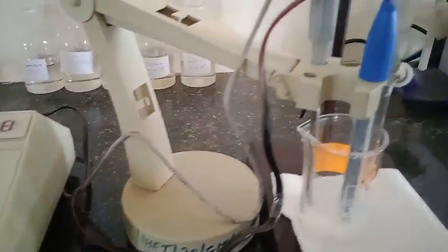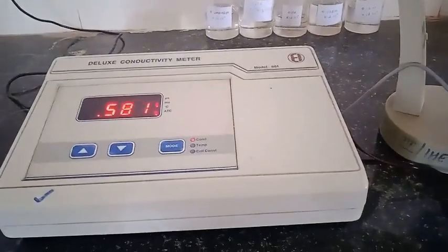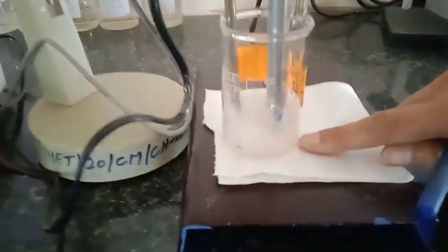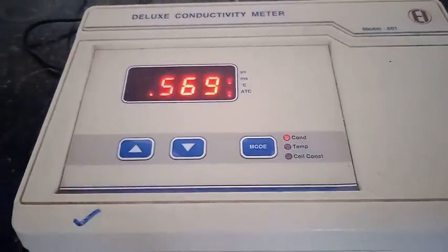We continue this process of addition of AgNO3 until we are not getting the minimum value. Once it starts increasing we will continue up to a certain extent. Here you can see the white precipitate of AgCl forming. I have not added any indicator to this solution because that can also contribute towards the conductivity. So the reading is continuously decreasing.